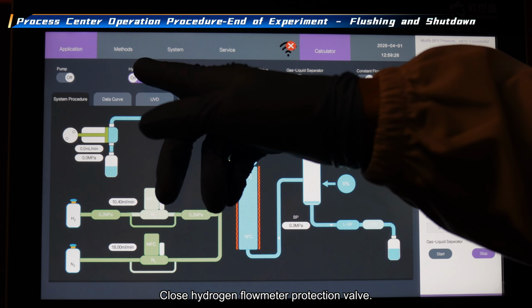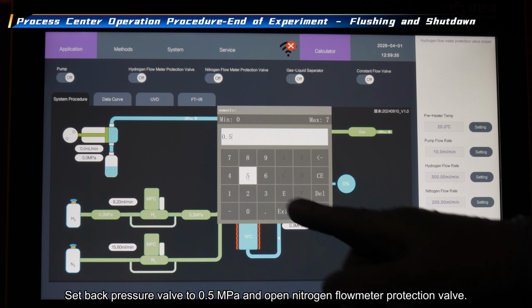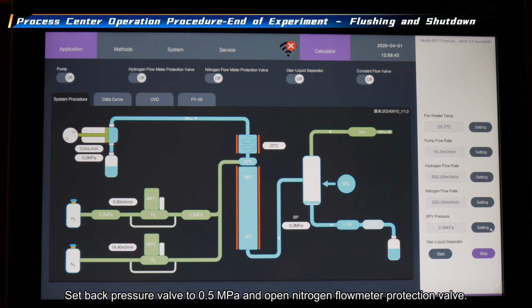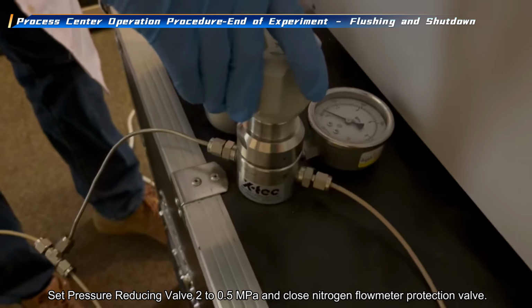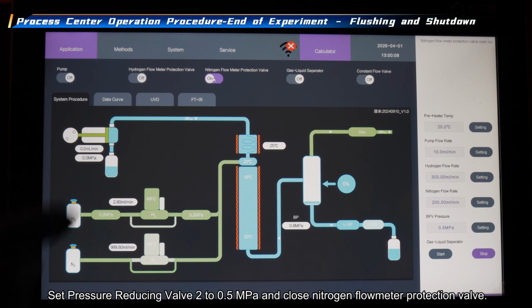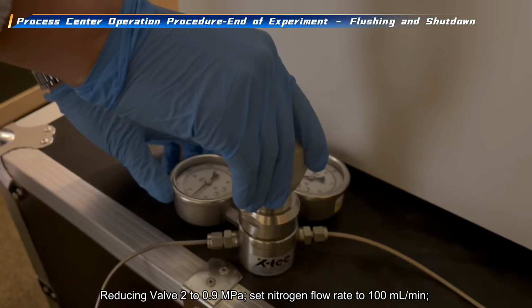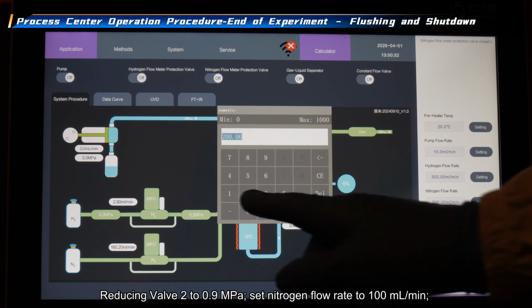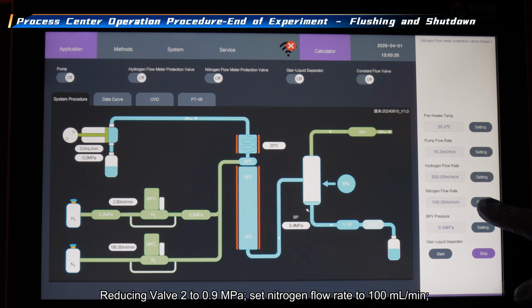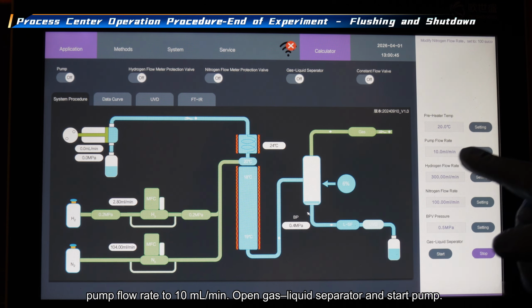Close hydrogen flow meter protection valve. Set back pressure valve to 0.5 megapascal and open nitrogen flow meter protection valve. Set pressure reducing valve 2 to 0.5 megapascal and close nitrogen flow meter protection valve. Set reducing valve 2 to 0.9 megapascal. Set nitrogen flow rate to 100 milliliters per minute. Pump flow rate to 10 milliliters per minute. Open gas liquid separator and start pump.